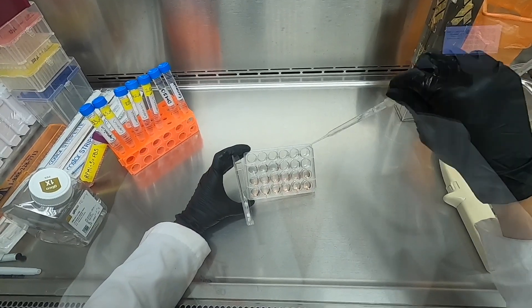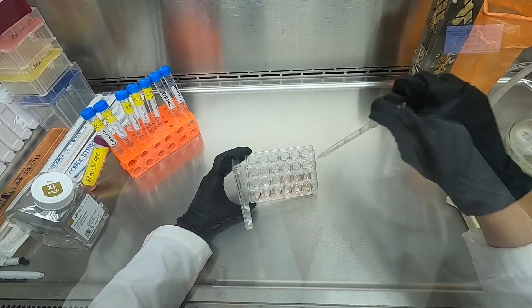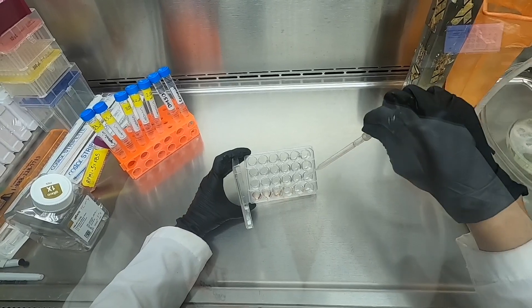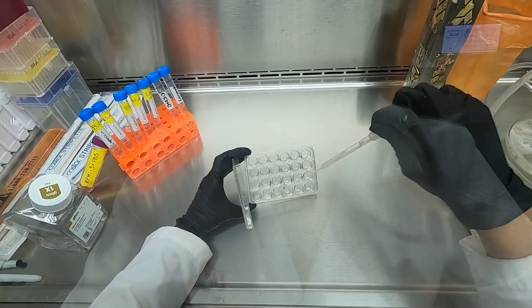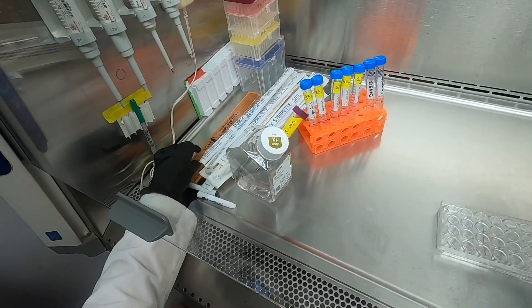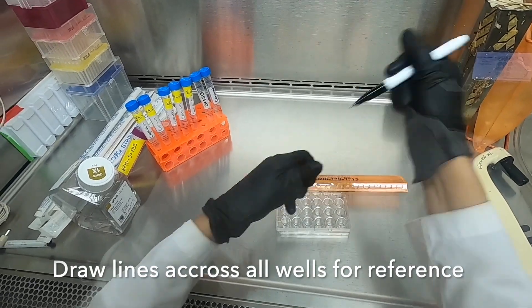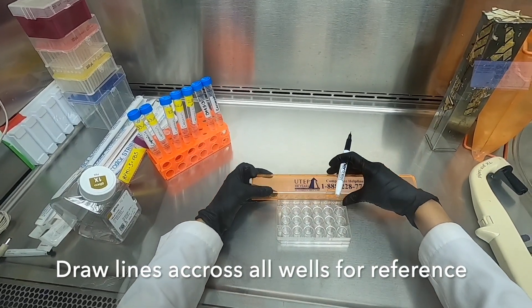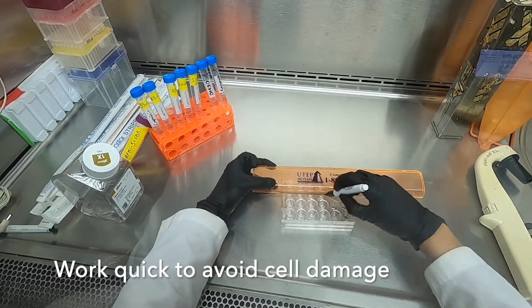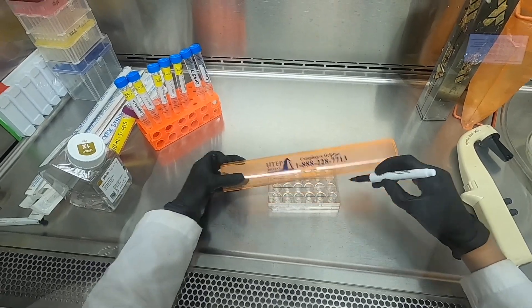First we remove the culture media in order to replace it with new media containing our capsaicin dilutions. It is ideal to aspirate the media of only a few wells at a time in order to prevent the cells from dying. Once we aspirate the media, we will make lines using a black marker across all wells. This line will serve as a reference in order to take the picture of the wound at the exact same position at every time point.